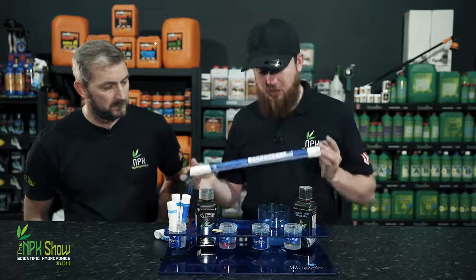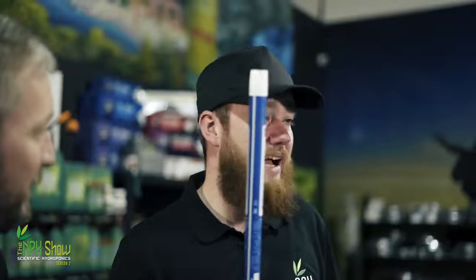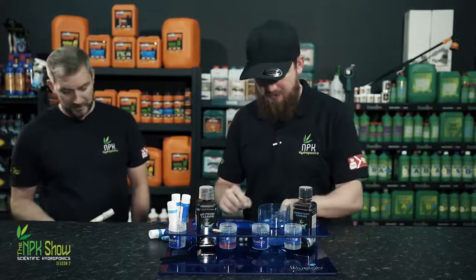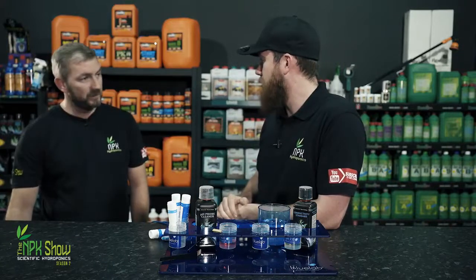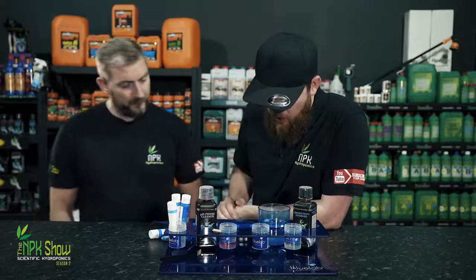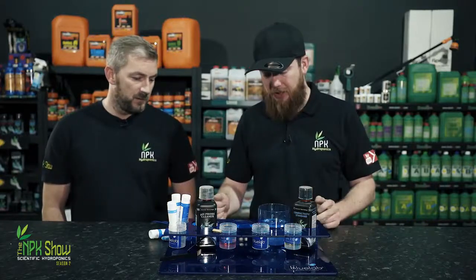But the EC truncheons, the reason that they're so good is, have you ever calibrated one? I've never calibrated one. That's probably never been calibrated. They don't need to be calibrated. That's never been calibrated, you know. It's just been kept clean. Yeah. If you look after your pieces of kit... And I've tested it against new ones, and it reads the same. So, they are the essential pieces of kit for EC and pH.